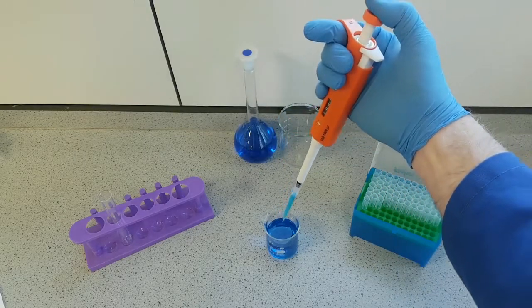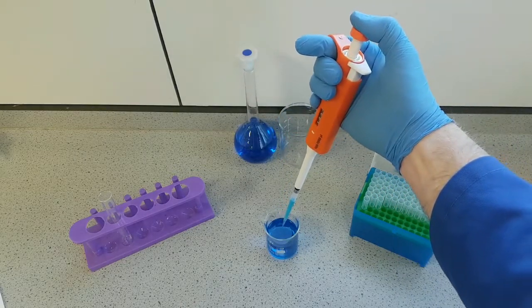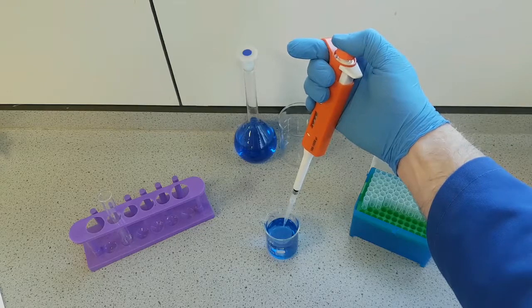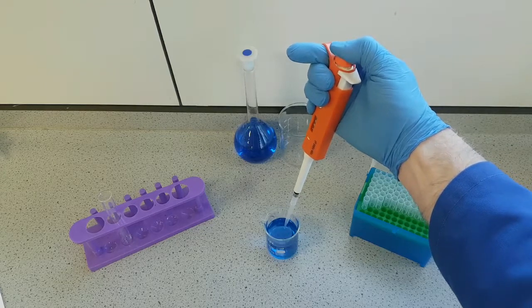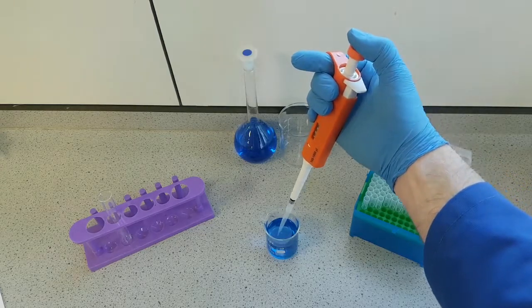To dispense our solution, press down to the first stage, and then down to the second stage to remove anything that's left in the tip.